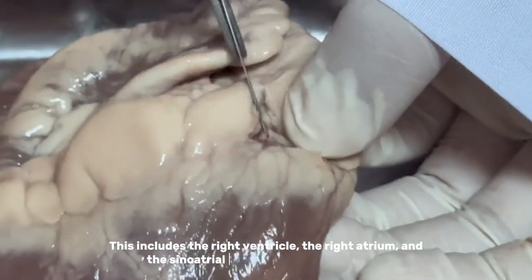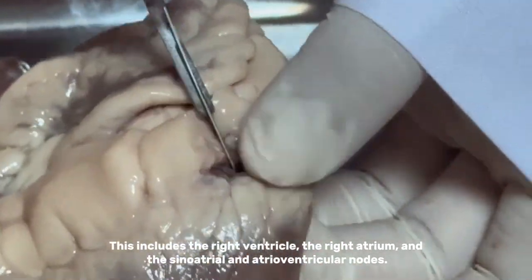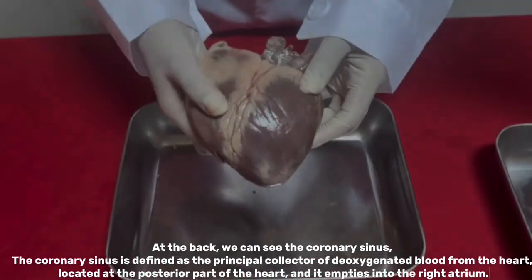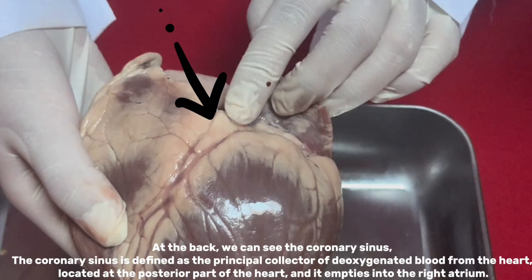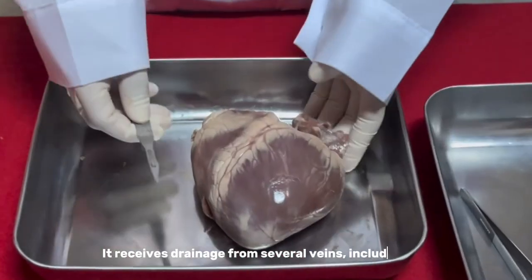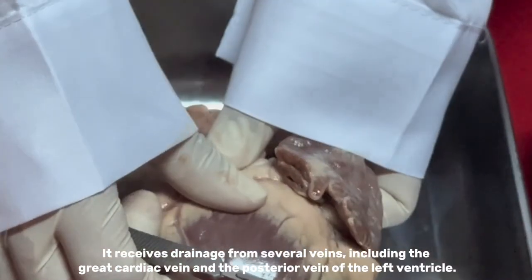This includes the right ventricle, the right atrium, and the sinoatrial and atrioventricular nodes. At the back, we can see the coronary sinus. The coronary sinus is defined as a principal collector of deoxygenated blood from the heart, located at the posterior part of the heart, and it empties into the right atrium. It receives drainage from several veins, including the great cardiac vein and the posterior vein of the left ventricle.